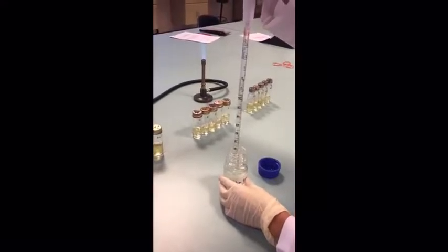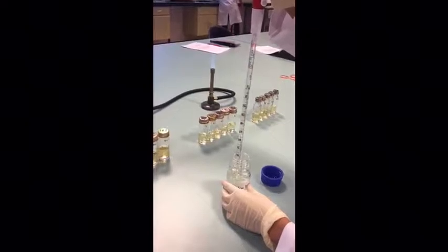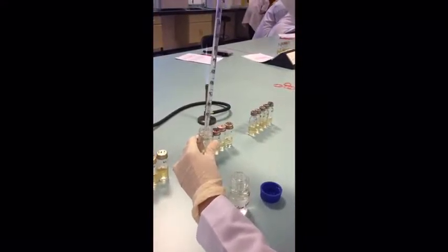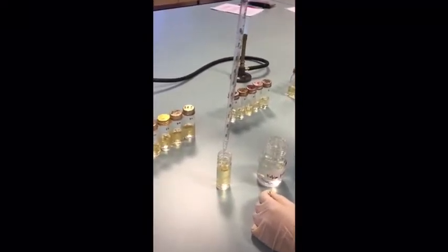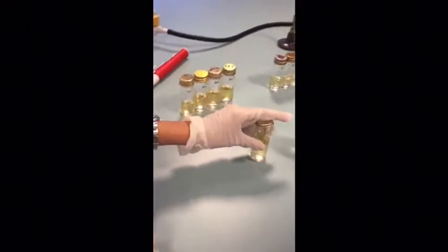Repeat the fourth broth tube with the same procedure as before. And so we cover it and we repeat the same for the next 4.